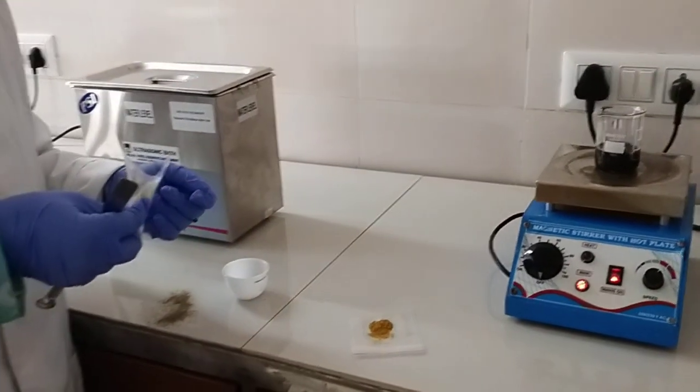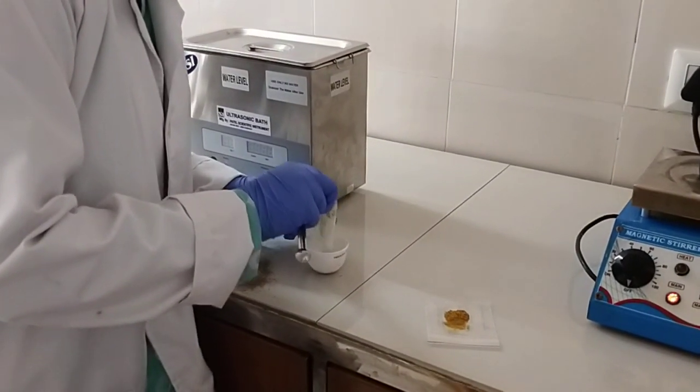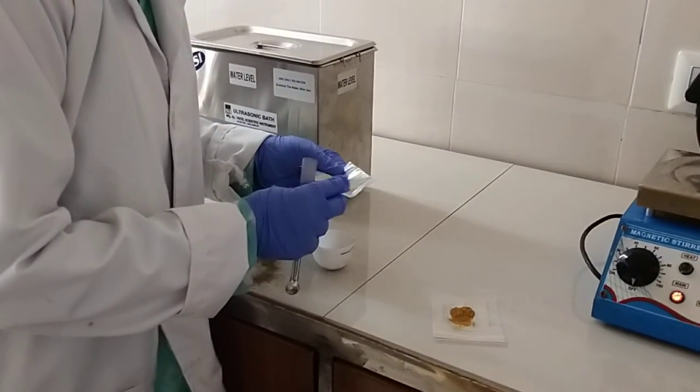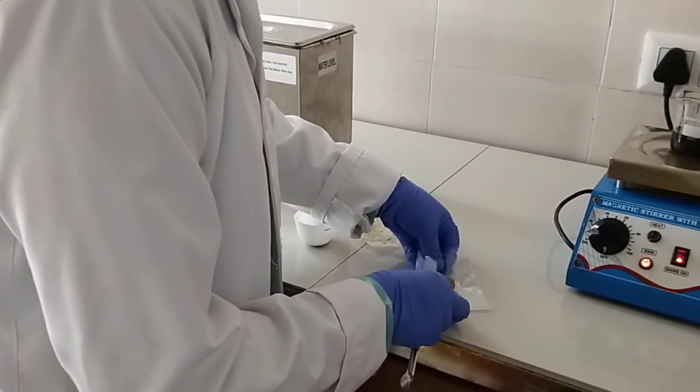Sorry. No, it's okay. It happens. They are only for learning to process it. But while you are doing this work, please be careful. It happens sometimes with everyone.